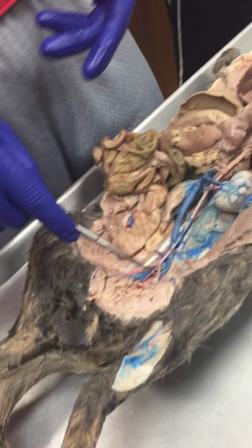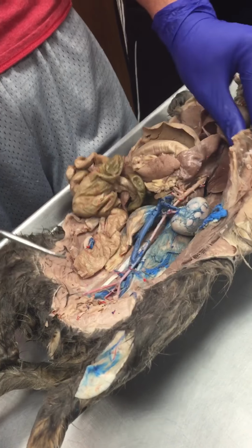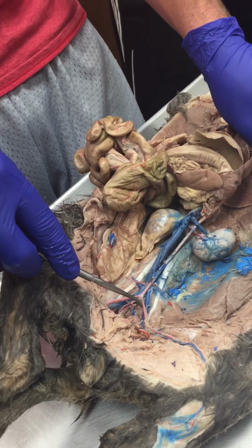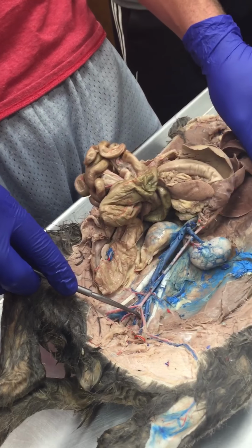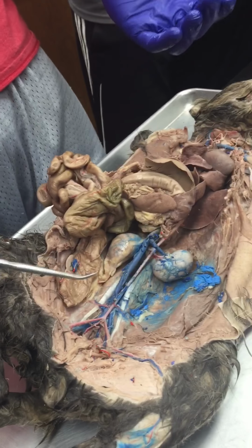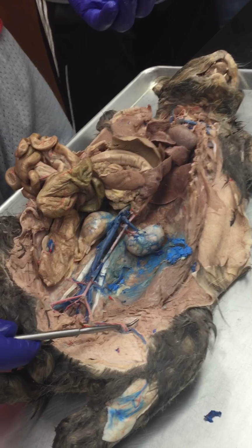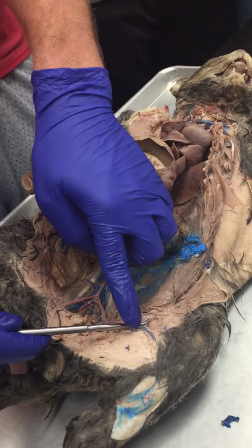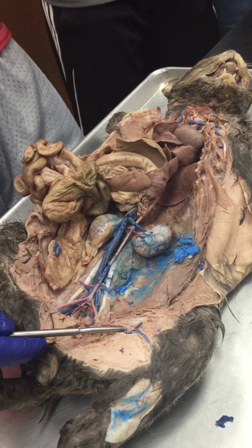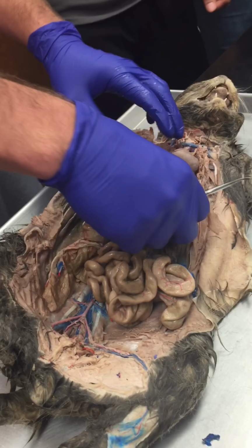And I was telling some other people that if I was to pin this, so if I wanted you to say iliac, I would pin it way up here, right after it veers off, okay? So I'd pin it up here. And if I was wanting to pin femoral, I would make it obvious and pin it as far down the leg as I possibly could. All right, so if you see a pin up by the branch, you know that's iliac. If you see it further down the leg, it's going to be femoral. Okay? And that's it for the arteries.